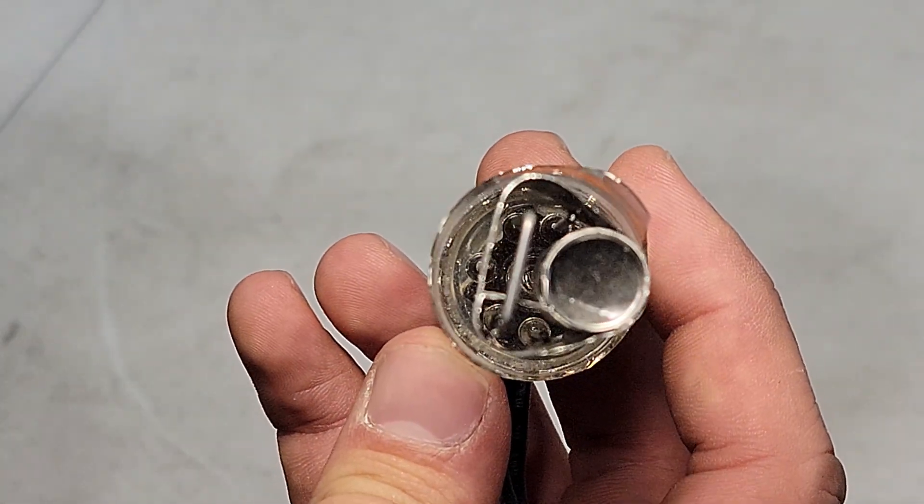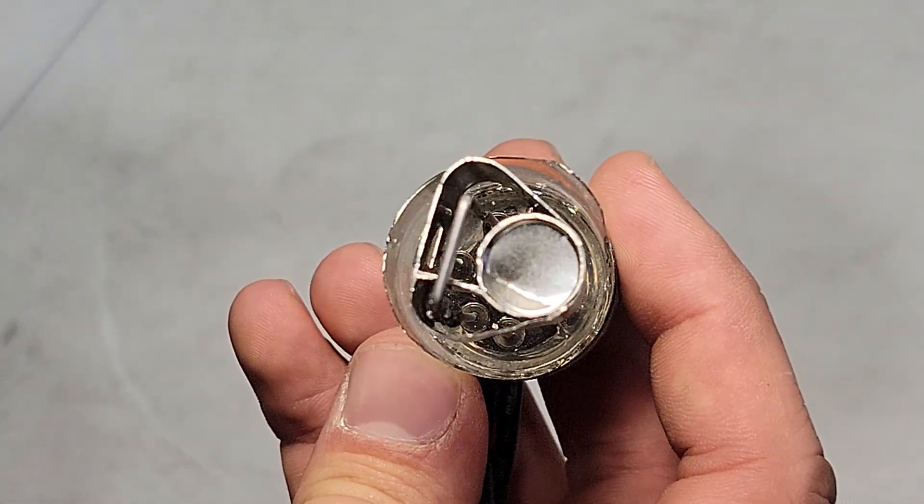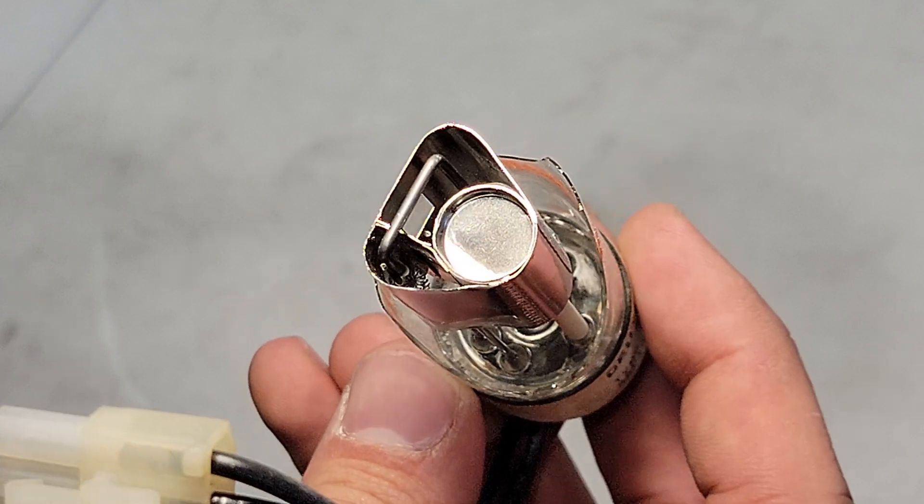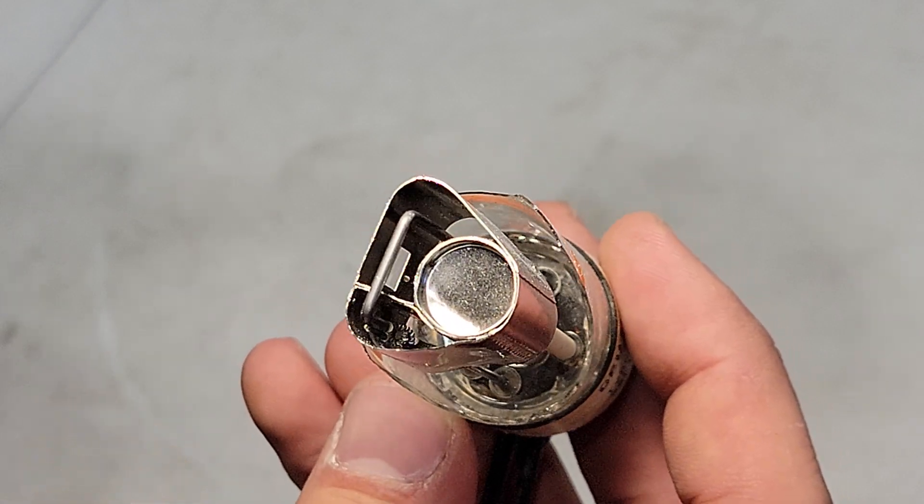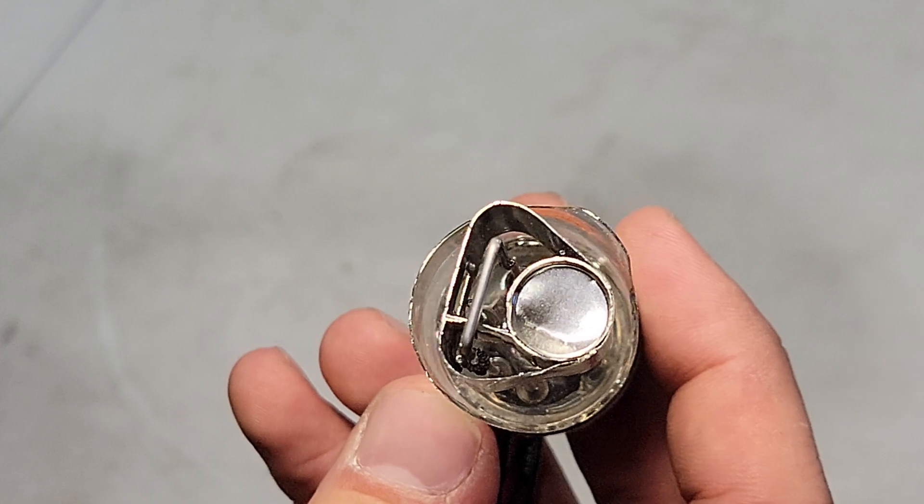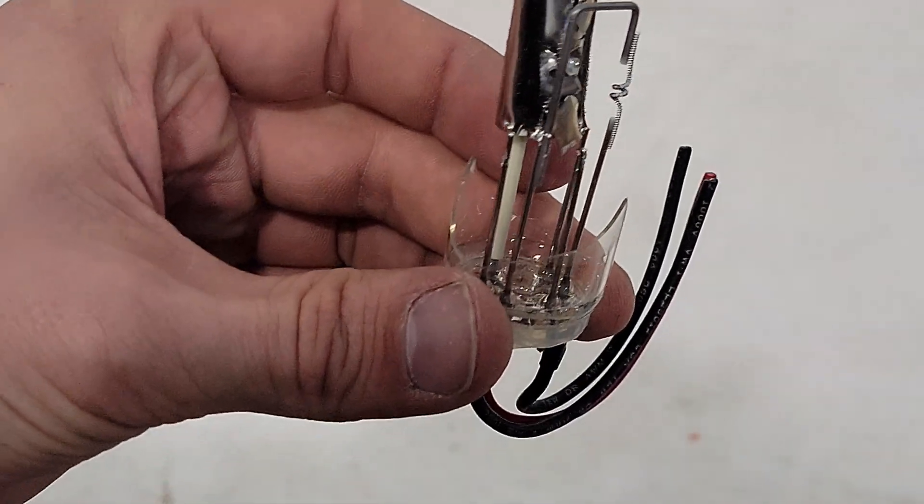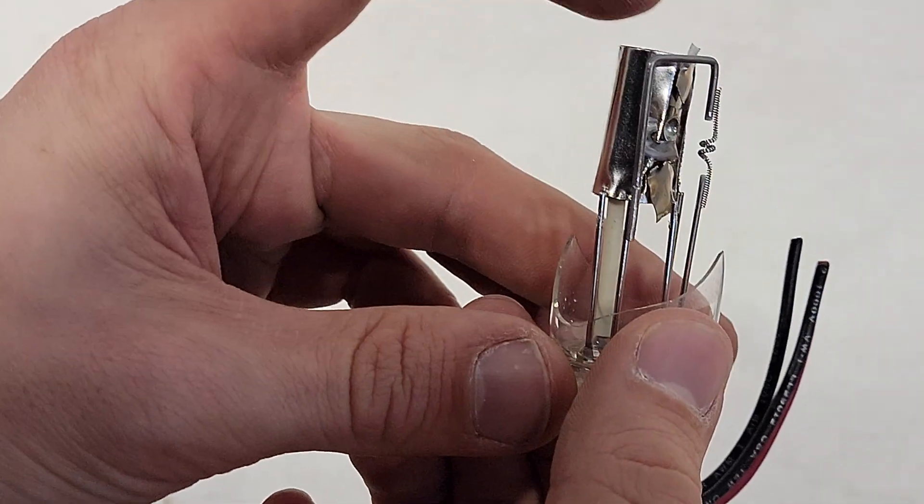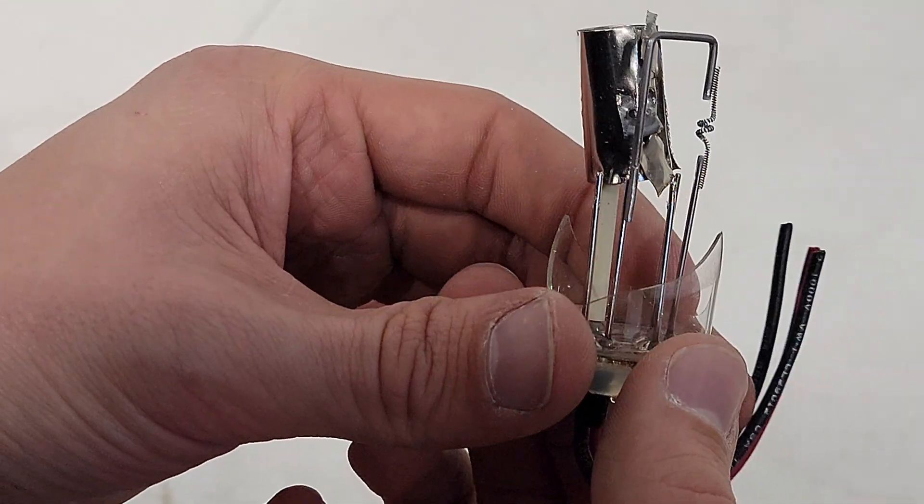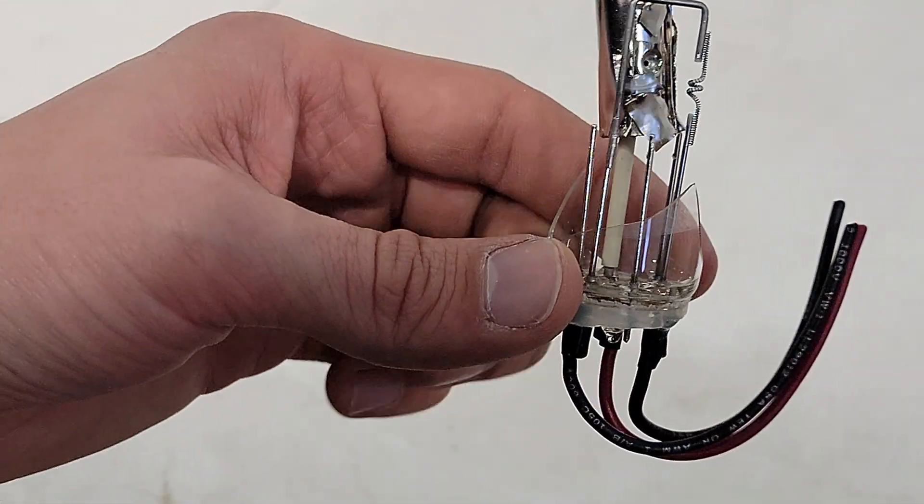The cathode is easily identifiable inside the lamp. It is the frontmost wiring coming up through the base of the tube. The anode is hidden by the metal casing. We'll tear into that later. On the cathode, you can see resistive wire heating elements that is coiled inside. This is to preheat the filament.